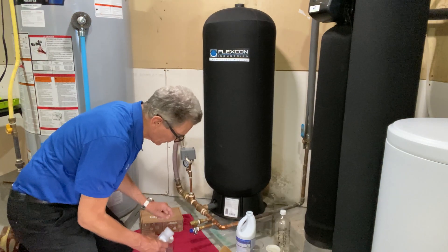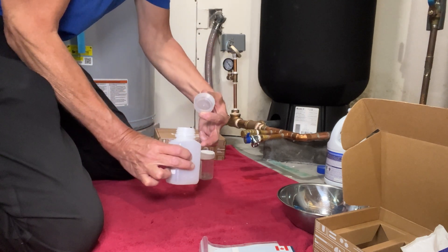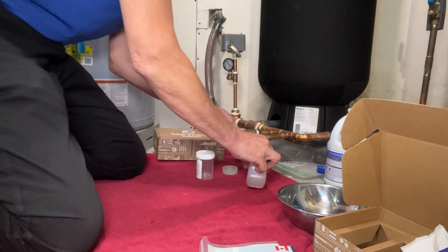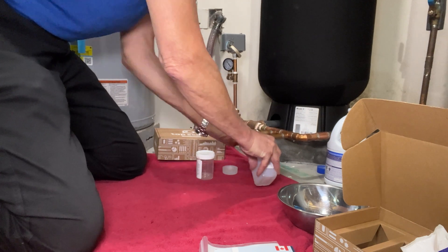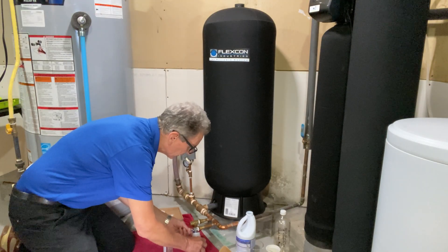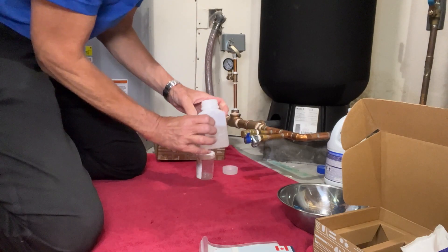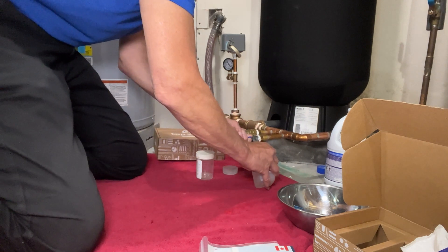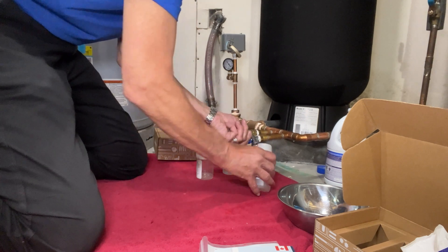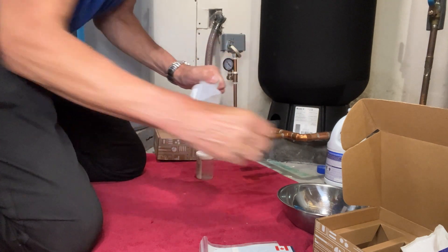To take the sample, be very careful not to put your fingers inside the cap or inside the bottle. You're only going to be filling the bottles up to the shoulder. Fill them slowly — it's better to fill slowly because then it's less likely that air will get in. You don't want to rinse these bottles out. Fill up just to the shoulder, then set that first bottle aside and put it back in the box, making sure it's closed tightly.